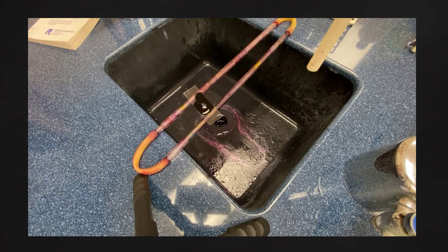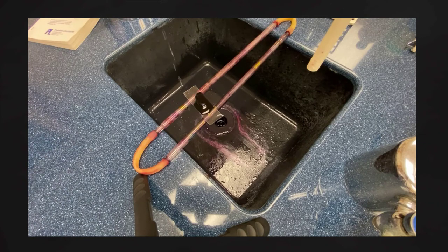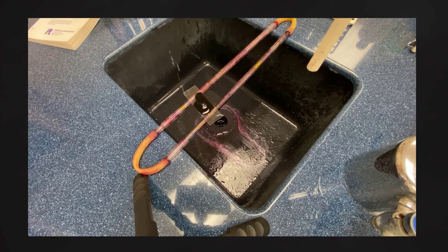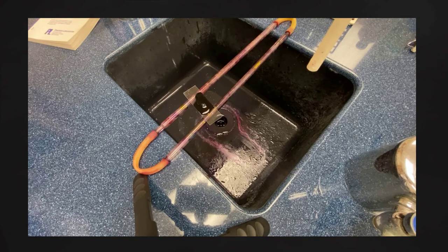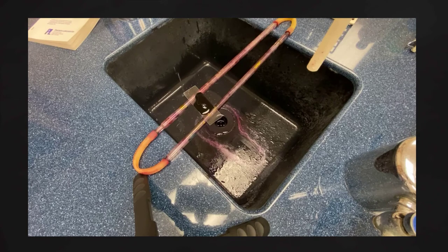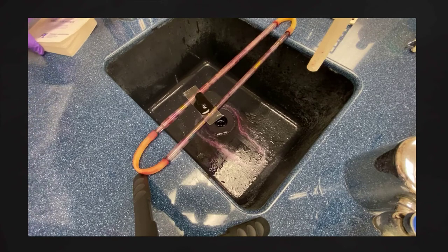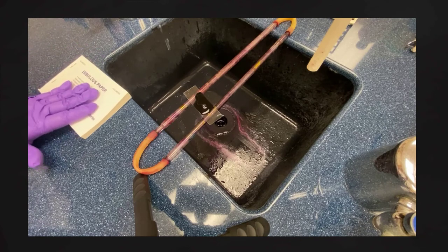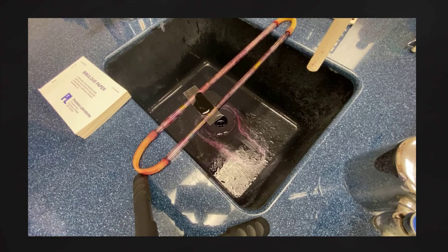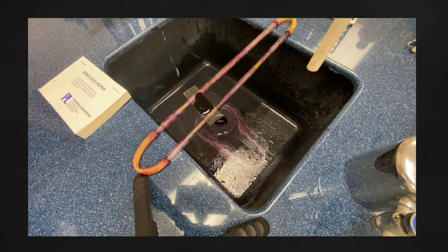This simple stain, using only the one stain, is going to allow us to see cellular morphology — in other words, whether the bacteria is coccus (circular), bacillus (rod-shaped), or spirillum (spiral-shaped). We will be using these slides on the microscope, so remember how to use the microscope so we don't break our slides, and make sure we understand the magnification as we go from low power to oil.